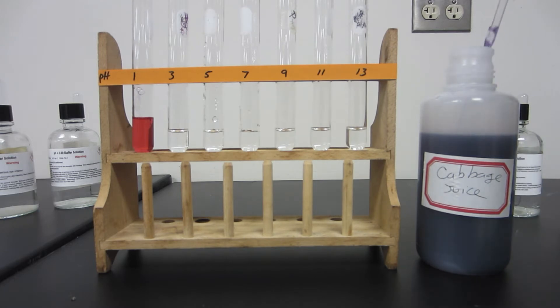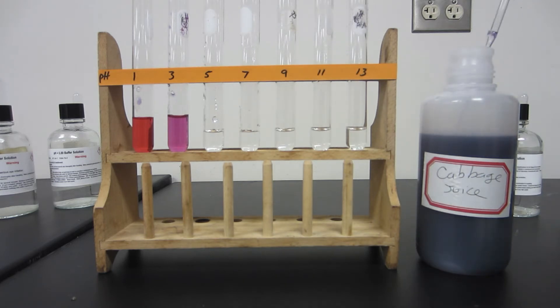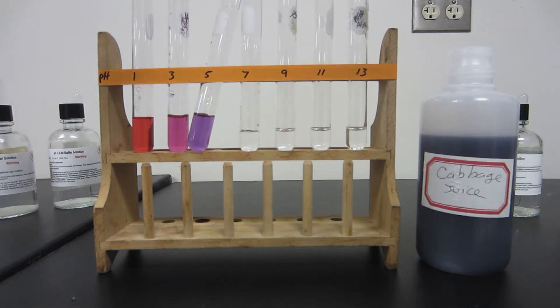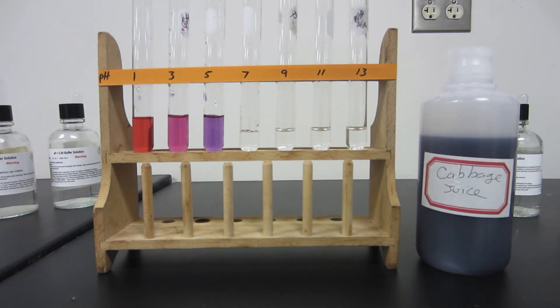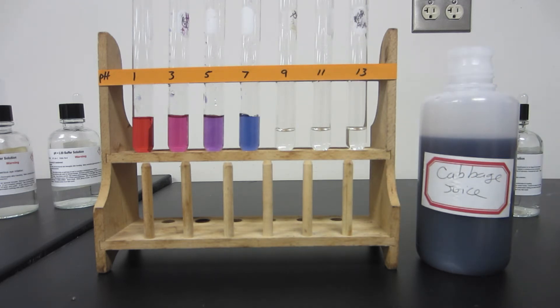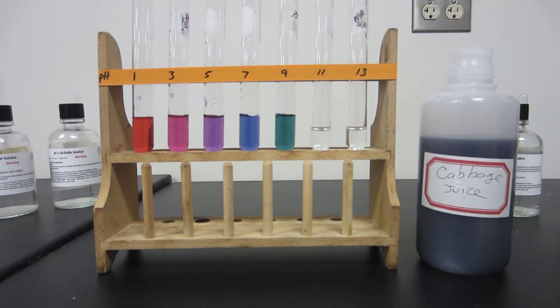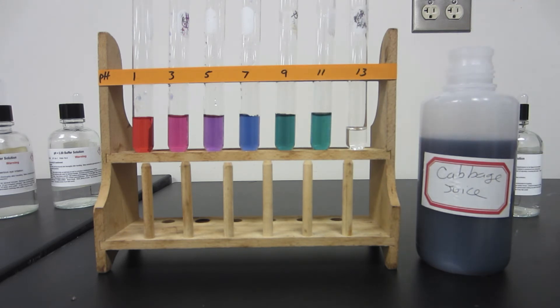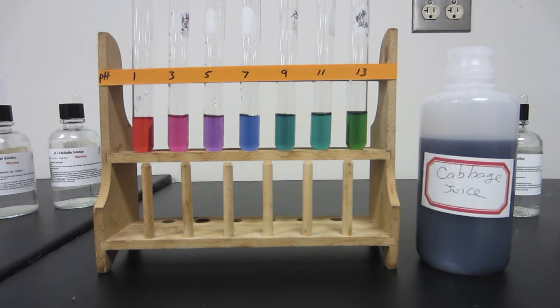The red cabbage juice is just that — I've taken red cabbage and chopped it up, boiled it in water for a little while, and you have the juice now. As I'm adding it to these different buffered solutions, you're getting different colors. This is going to be used as a reference for the pHs of a bunch of different solutions in this lab. You'll want to reference back to this image, which I'll post on Moodle so you can record your pHs of the solutions in part B and part C.